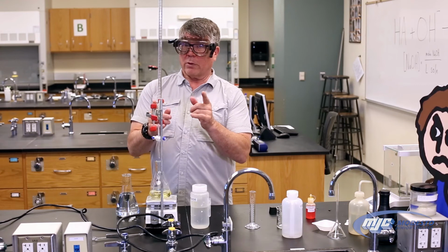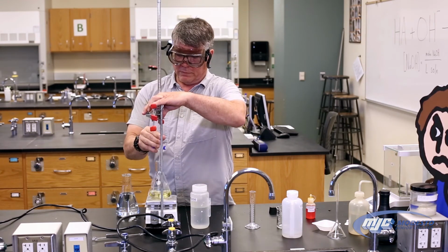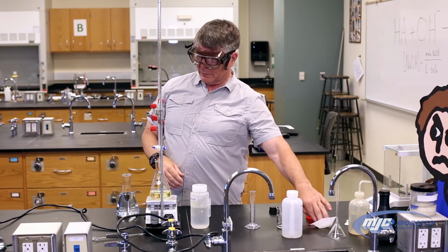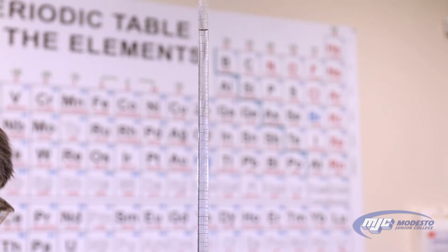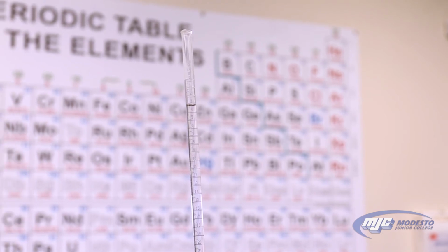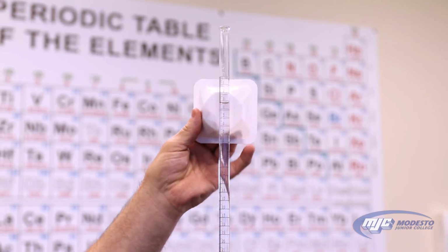Next thing, and this is important also, we need to make sure that we read the initial volume. This is the initial volume of the burette. Remember, we're going to measure that 2 places past the decimal. One little trick that helps is if the lines here are dark colored like these are, if you put something light in back of it, it's easier to see. Also, if these are light colored, put something dark in back. The contrast makes it easier to read.